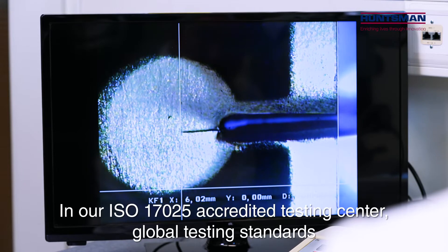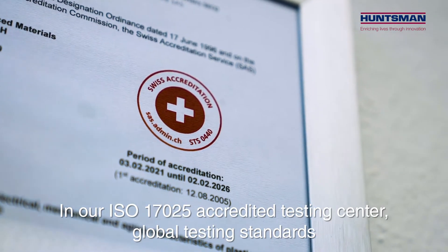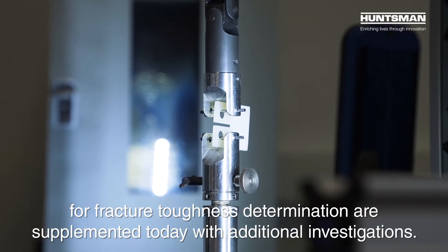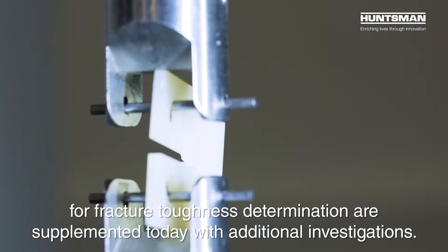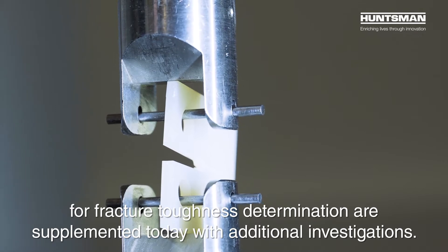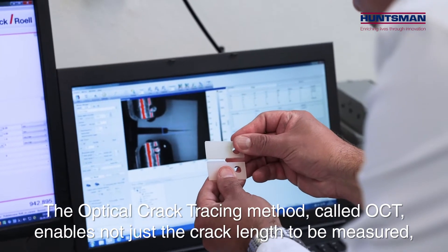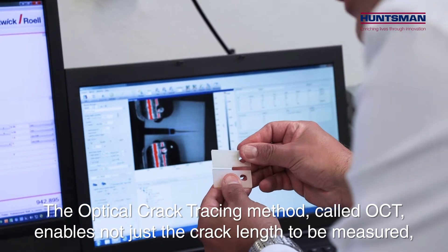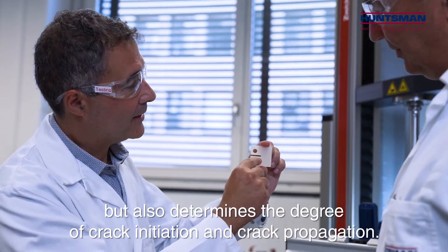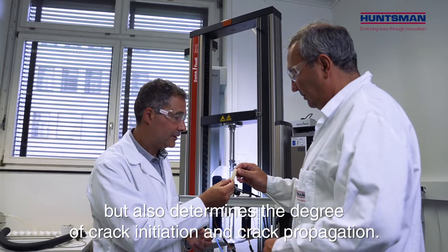In our ISO 17025 accredited testing center, global testing standards for fracture toughness determination are supplemented with additional investigations. The optical crack tracing method called OCT enables not just the crack length to be measured, but also determines the degree of crack initiation and crack propagation.